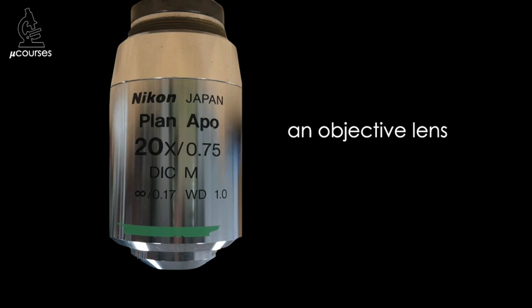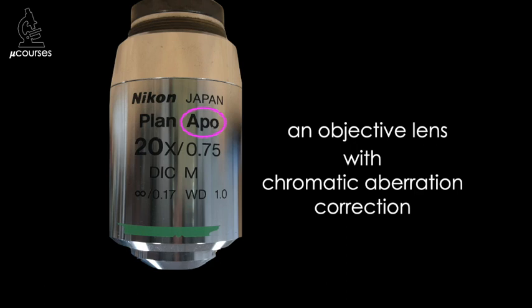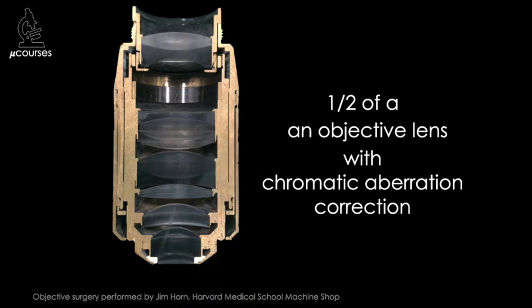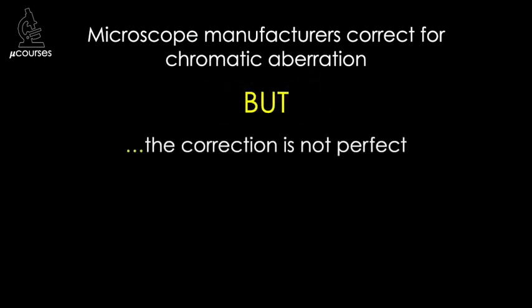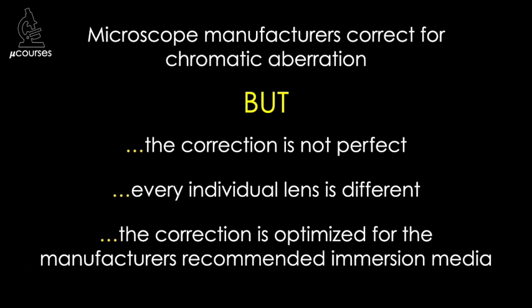Optics manufacturers know we'd prefer this is not going on in our microscopes, so they do the best they can to correct for chromatic aberration. Lenses that are marked 'Apo' are highly corrected for chromatic aberration and therefore often the best choice for samples labeled with multiple fluorophores. Chromatic aberration correction is achieved in part by adding additional elements to the objective lens — this objective lens was damaged beyond repair, so I asked our machine shop to cut it in half so we can take a look inside. We can see there is a lot going on inside these lenses, and some of these components help to correct for chromatic aberration. However, every individual lens is different, and the correction is optimized for the manufacturer's recommended immersion media, so if you're using a different brand, you may find that chromatic aberration increases.